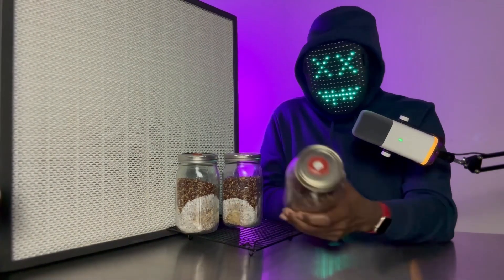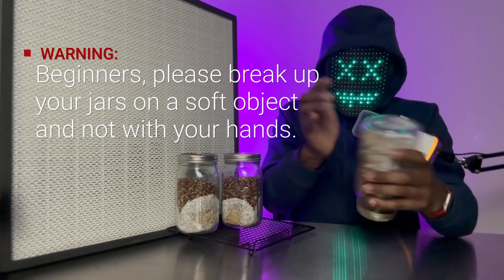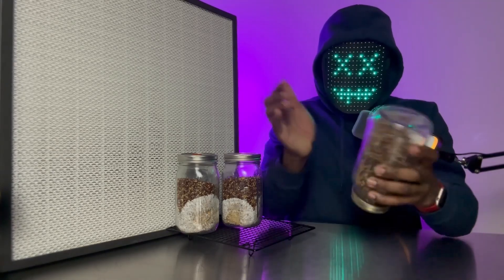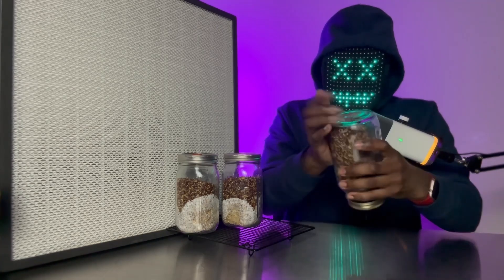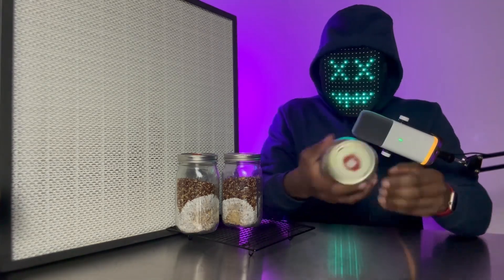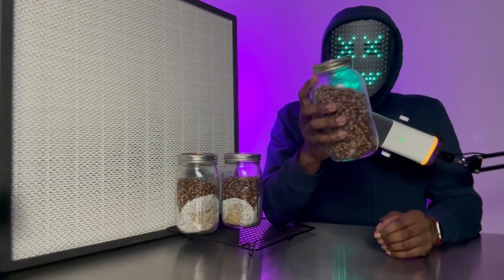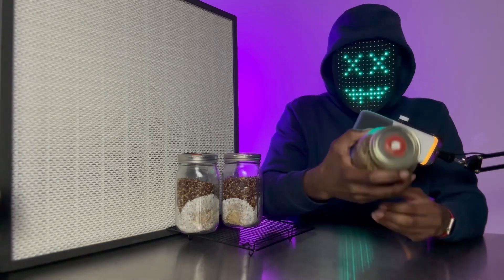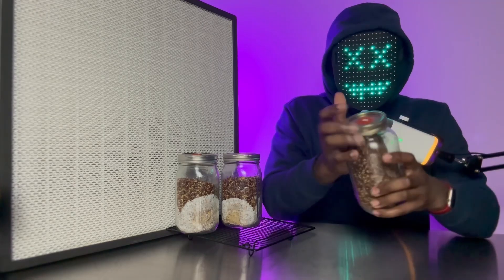What I like to do when I'm breaking up my jars is turn my jars upside down like this and just lightly tap the jar as I'm turning it 360 degrees, just like that. This helps to break all that myceliated grain up. And after I've gotten it all broken up, continue to rotate it but also shake the jar.